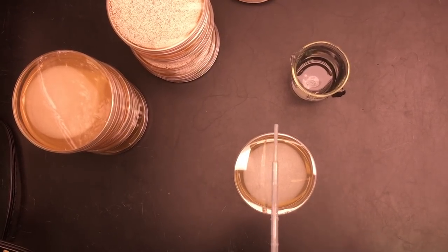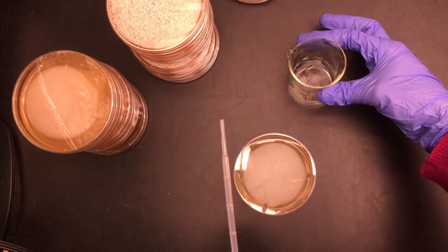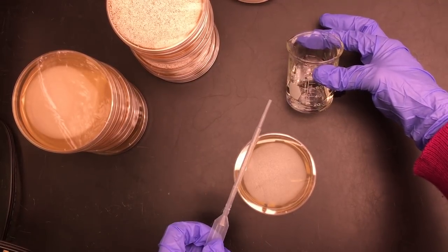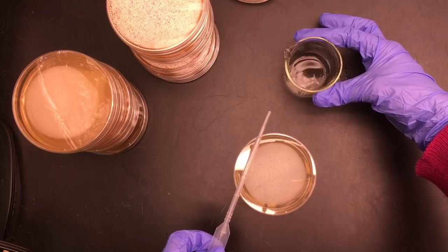The next test that we're going to do is on fish tank water. So I went over to my aquarium and I got a sample here. I just scooped out some water from my fish tank.